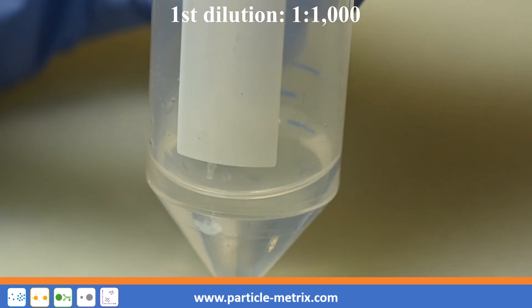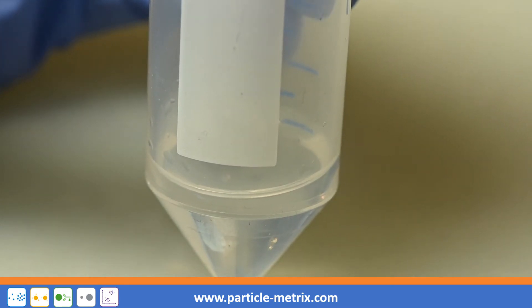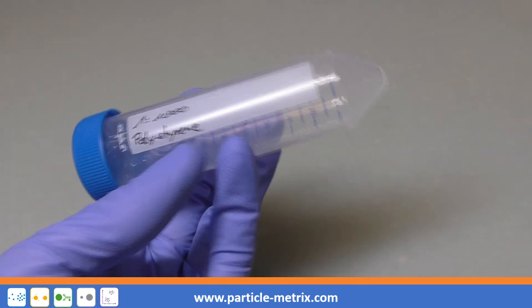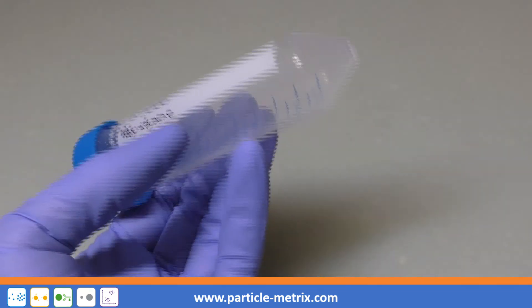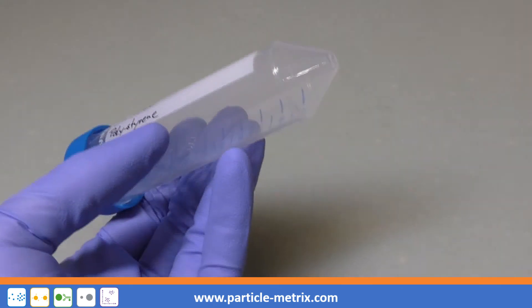This yields a 1 in 1000 dilution. Scale up or down if necessary. Mix the solution thoroughly but gently to avoid creating ultra-fine bubbles.